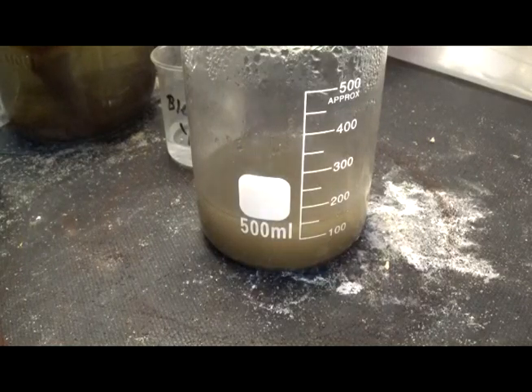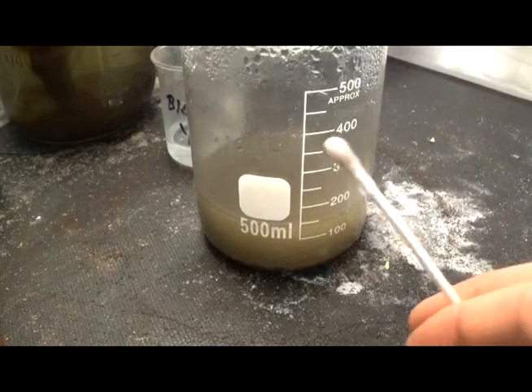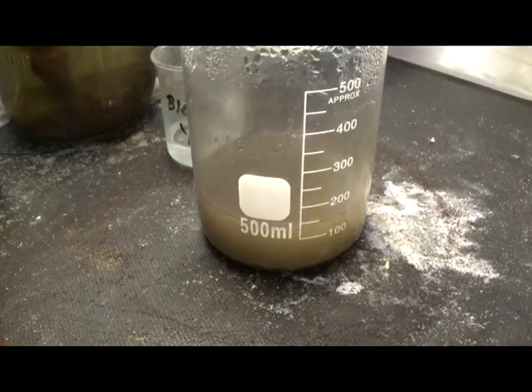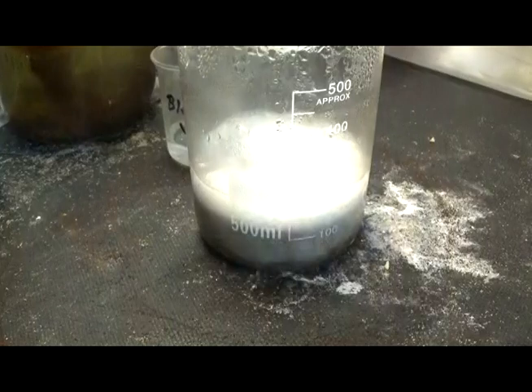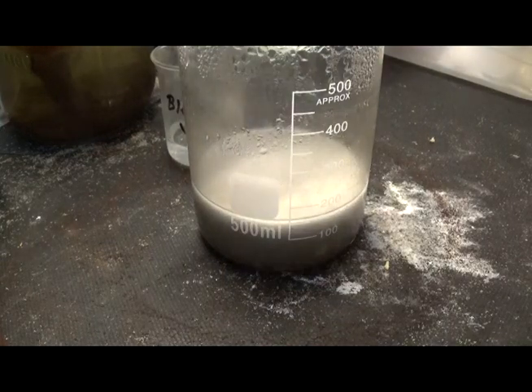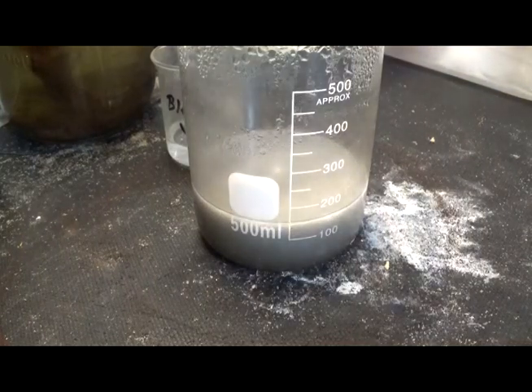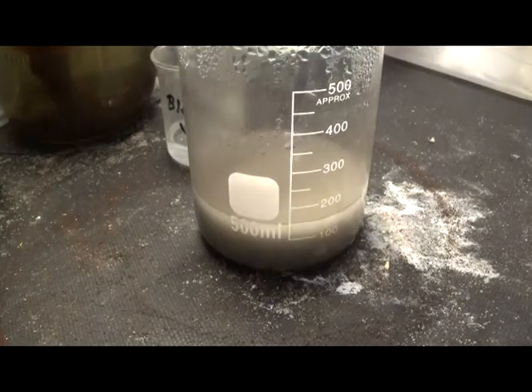Yeah, it's going to take a little bit more SMB. There's still a little bit of gold left in solution. We'll show it to you at least. We'd have a little bit left. So we're going to do a little bit more. And this should do it. Right there, that's how you can tell. I call it when you see the fizz fizz, that usually tells you you got a good drop. So we're going to sit there and let this drop out and settle out.